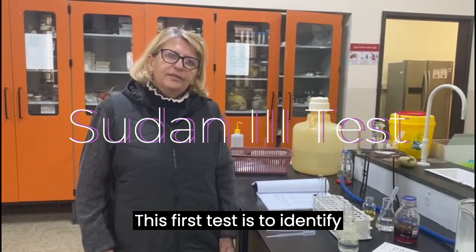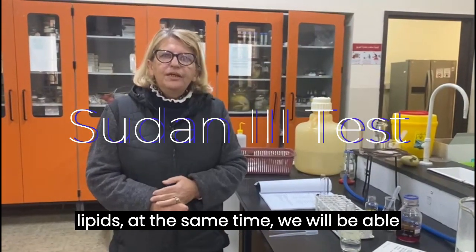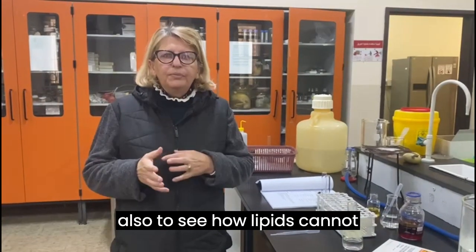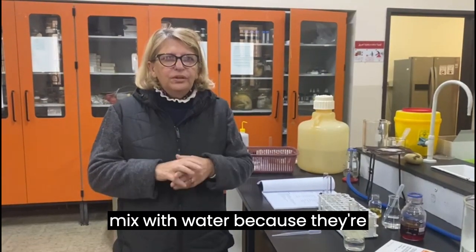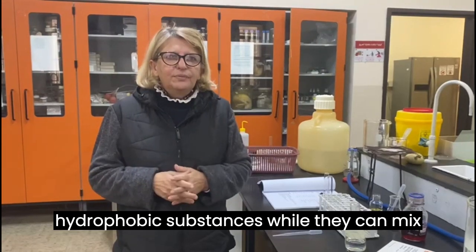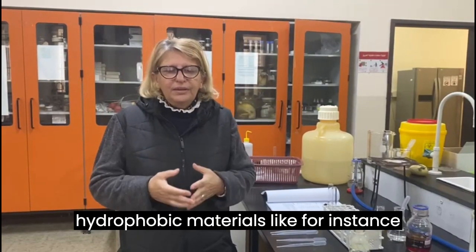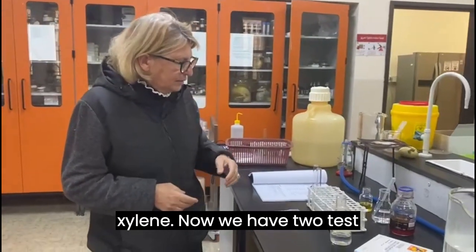This first test is to identify lipids. At the same time, we will also be able to see how lipids cannot mix with water because they are hydrophobic substances, while they can mix with other hydrophobic materials, like for instance xylene.